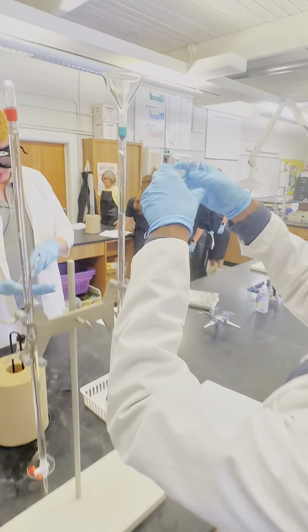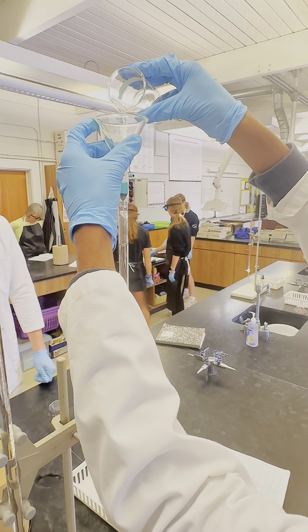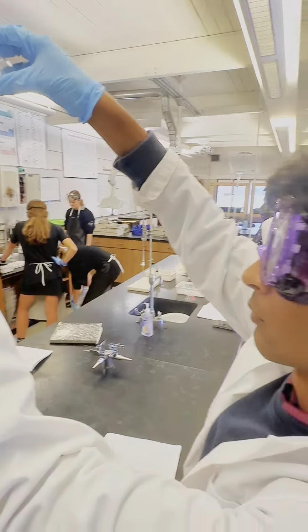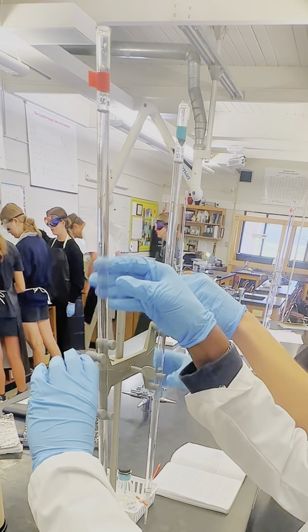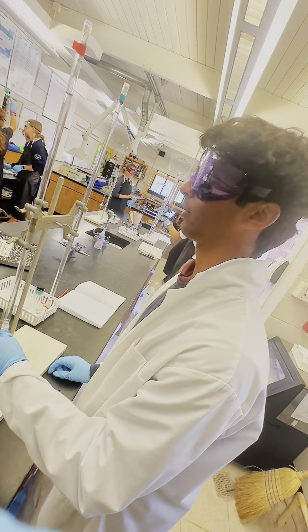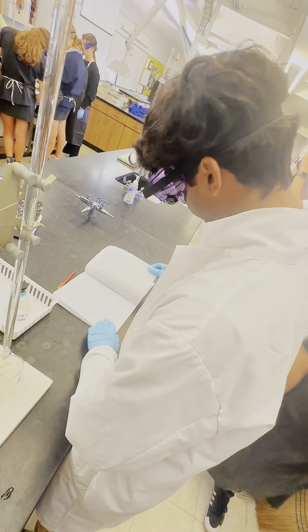2 clean burettes were set up. It was decided which burette would be used for acid and which for base. The acid burette was rinsed 3 times with the acid that was used in the titration. The base burette was also rinsed 3 times with the base. The first burette was filled to a point above the 0 milliliter calibration mark with the acid. The approximate volume of 8 milliliters of acid was then flowed into a clean Erlenmeyer flask. The volume of the acid was recorded to the nearest 0.01 milliliters as the initial volume.